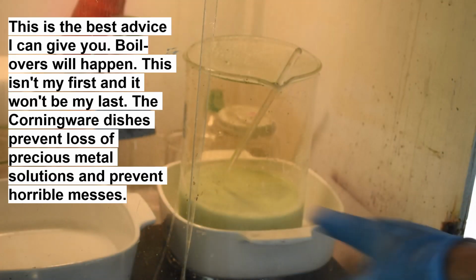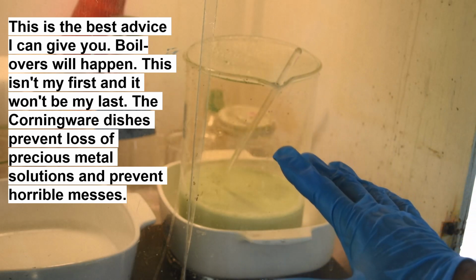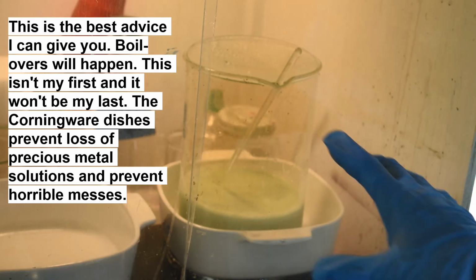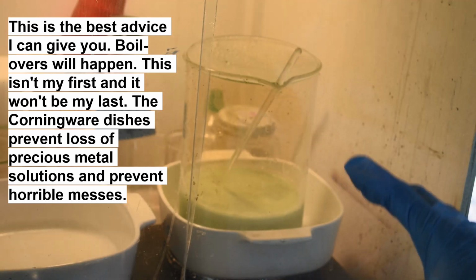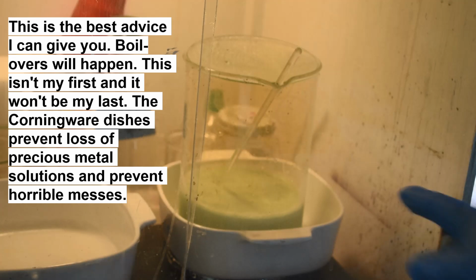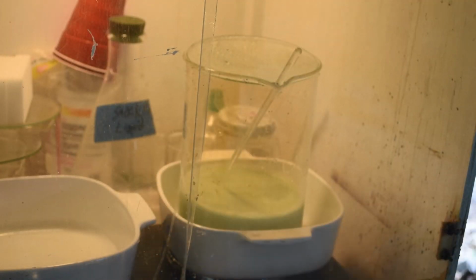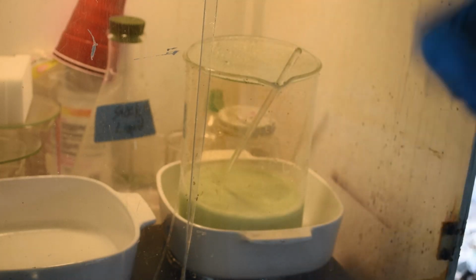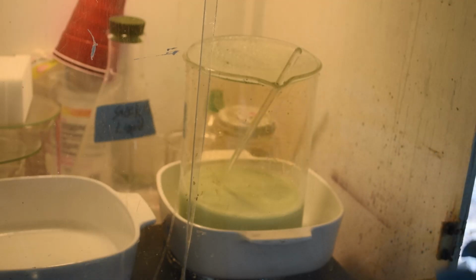These Corningware dishes, they are invaluable. Just saved me from losing all this stuff and saved me from a horrible mess in my fume hood that would probably ruin my hot plate and take forever to clean up. So get yourself some Corningware dishes. They're cheap. You can get them at garage sales. You can get them at thrift stores. You know, they're dirt cheap. I don't think I've paid more than a few bucks for one. And I've got dozens of them. So get yourself some if you're going to do this.